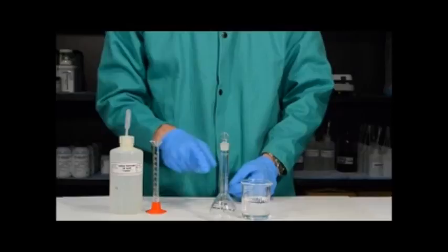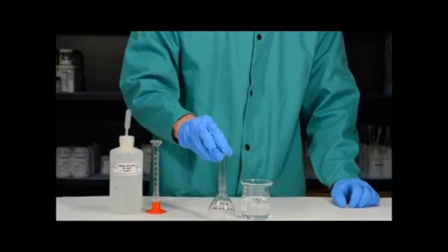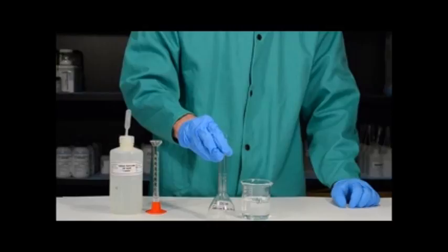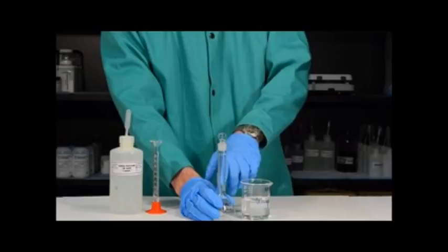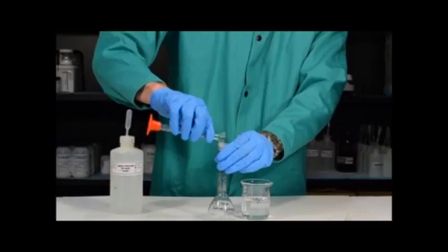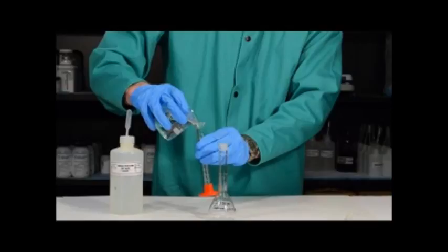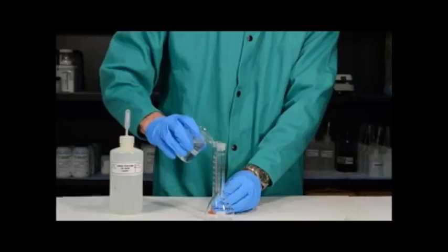Next I want to quantitatively transfer the 2 milliliters of sodium hydroxide solution into the volumetric flask. A volumetric flask is very similar to a volumetric pipette in that it has only one job — this volumetric flask's job is to hold 100 milliliters of solution and it has only one line, which is the 100 milliliter line. To quantitatively transfer, I first pour the sodium hydroxide solution into the volumetric flask, then use a few small portions of water to rinse the graduated cylinder completely of all sodium hydroxide solution so that I can be sure all of it is in the volumetric flask.